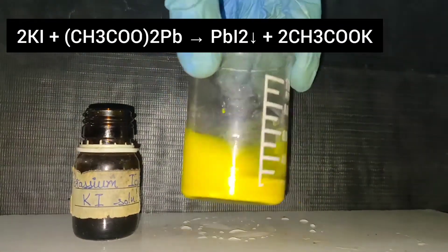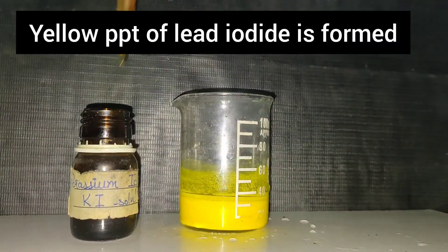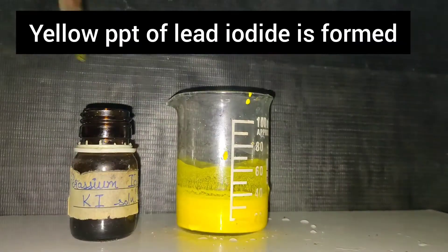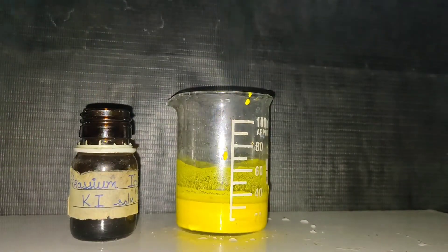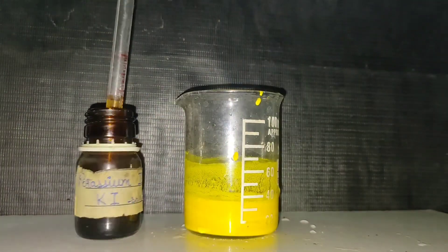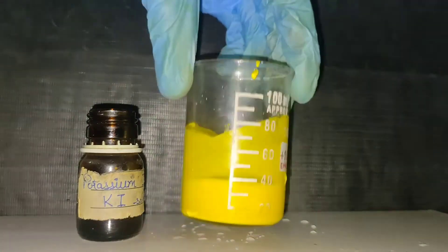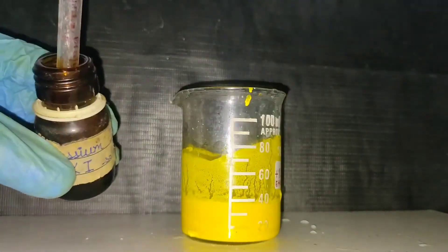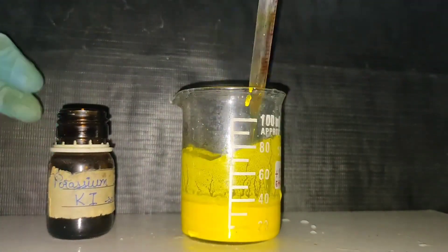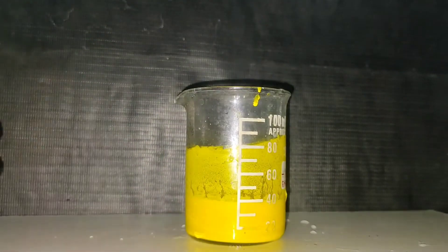You can see the reaction occurring is shown above. A yellow precipitate of lead iodide is formed. Potassium iodide solution is added drop wise until the formation of precipitate stops.